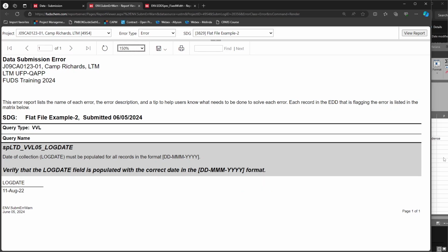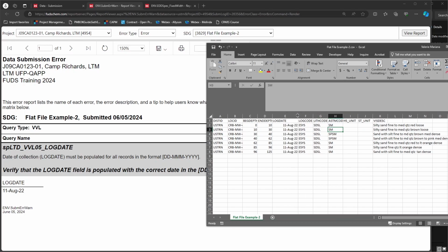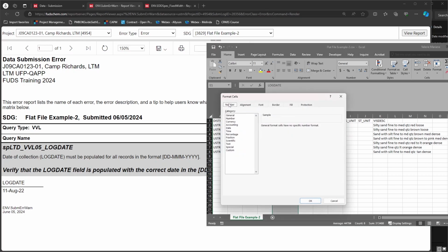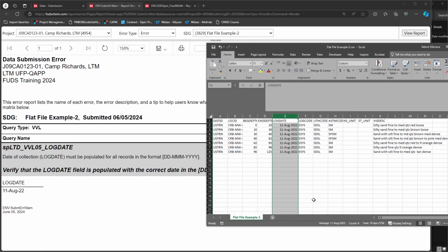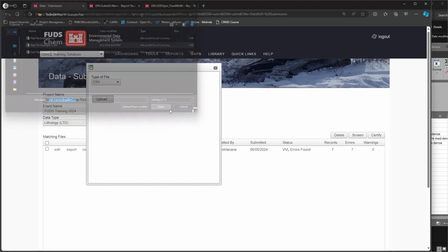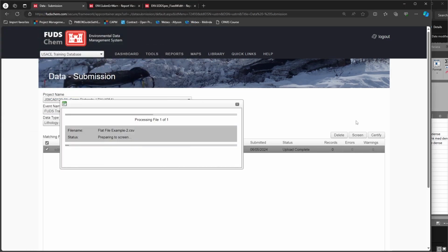Let's open our file. To reformat the dates, we will highlight the Dates column, right-click and choose Format Cells. On the Number tab, choose Custom. Type in DD-MMM-YYYY. The sample text above will show you the correct date format. Click OK. Let's save the file as a CSV. Let's re-upload our file and then screen it. We've successfully resolved our error and the file is ready to certify.